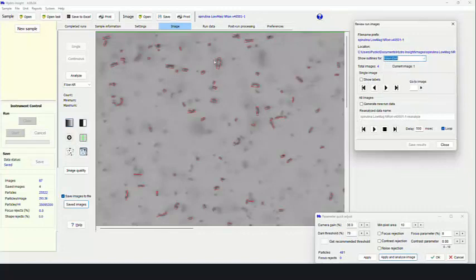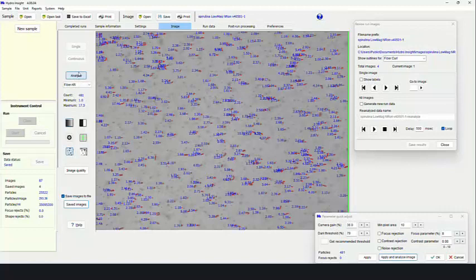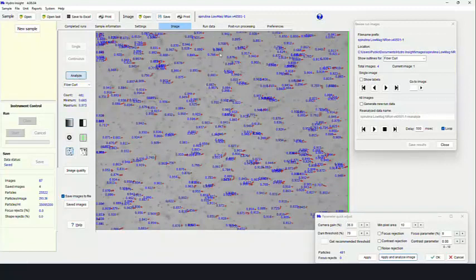So fiber curl is actually a very interesting measure. Fiber curl will tell you the amount of curvature there is on every fiber. So basically, if we zoom back out and hit analyze, we could see the curvature of every fiber. Well, this is aspect ratio. Sorry, let's go to fiber curl. So, for example, when you get a fiber that's very curved, it'll be further away from 1. When they're more curved, there'll be a much lower number. So again, fiber curl, very useful when you're working with fibers such as the spirulina.